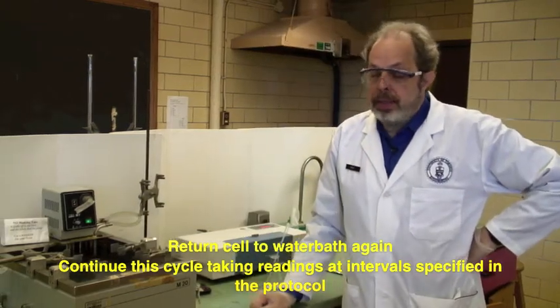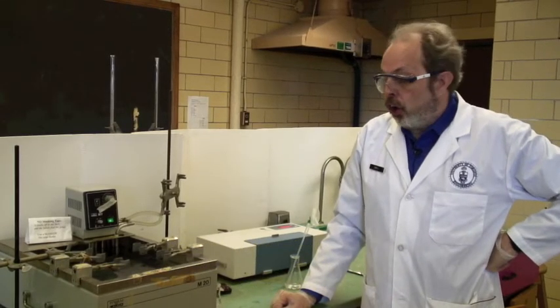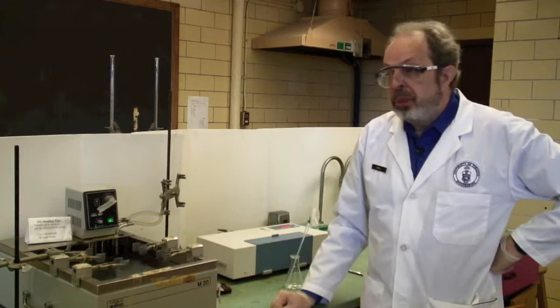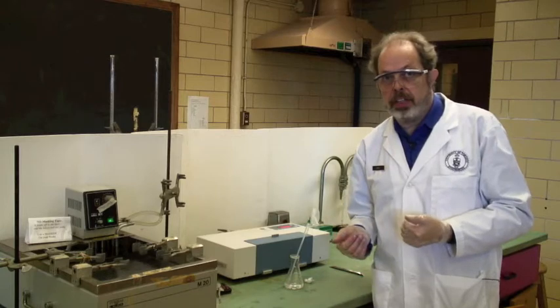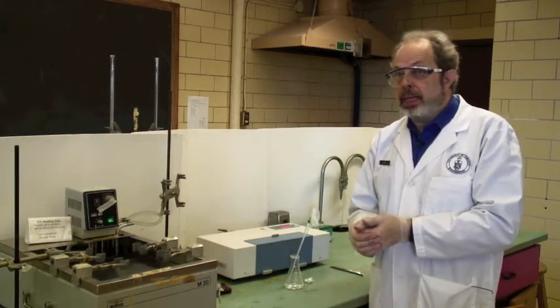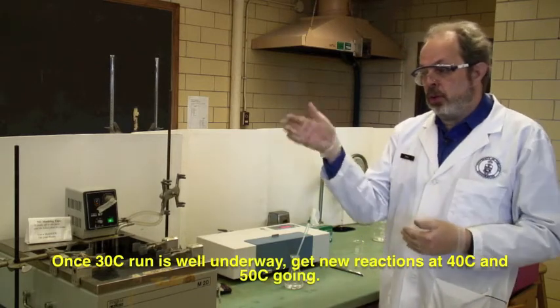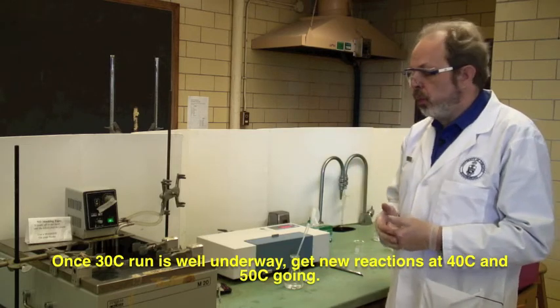And you do that until you have gained the appropriate number of readings on each of the mixtures. We're going to have you actually start with a cool bath at 30 degrees because that has more time in it. It moves more slowly. And then when you're used to doing that, you can do it in the 40 and the 50 degree baths. And those ones move quite quickly.